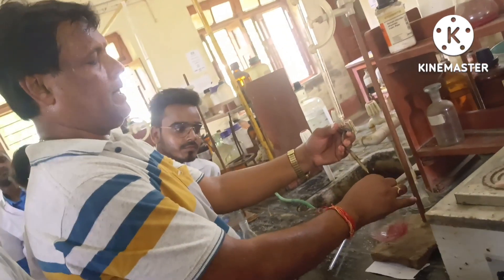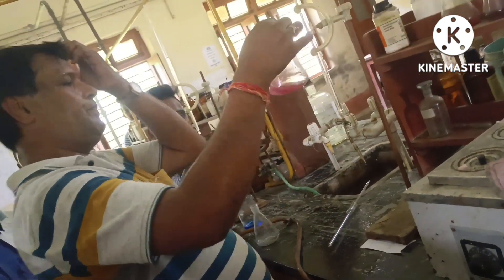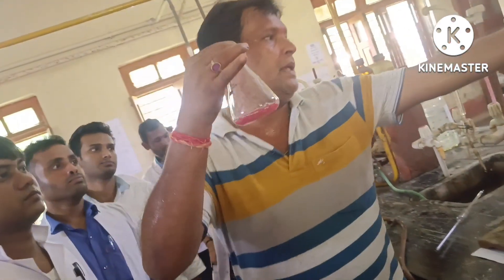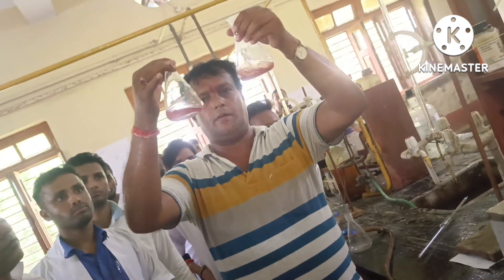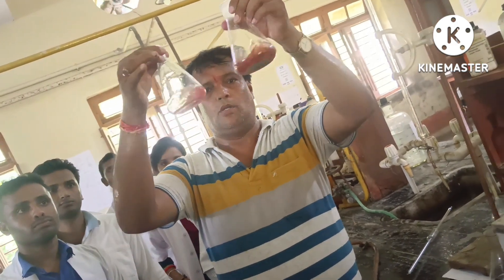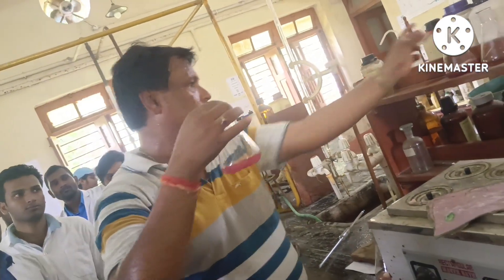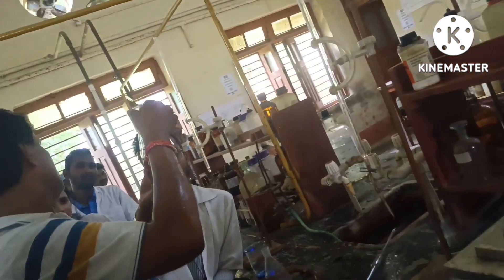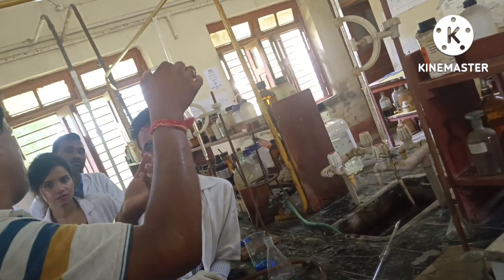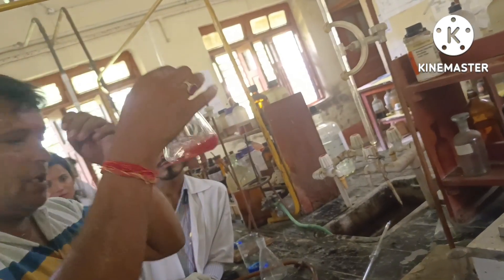Now just see the color — we have repeated this experiment three or four times. See the color. This is the precipitate of Cu2O — copper oxide. This is the precipitate of Cu2O, copper oxide.